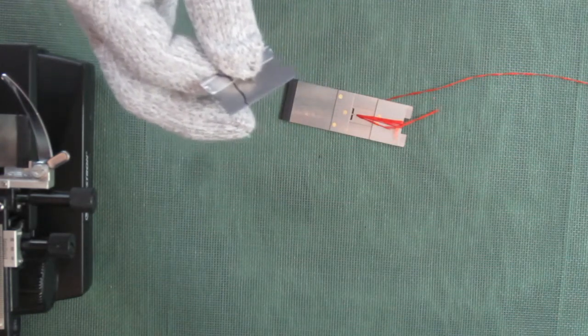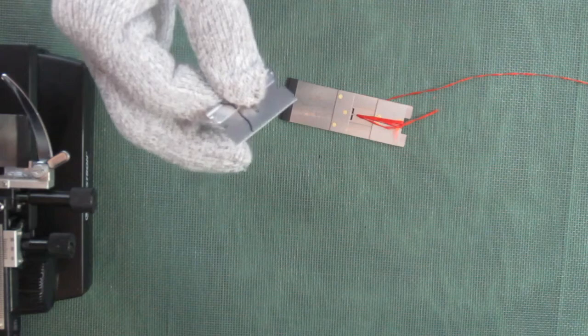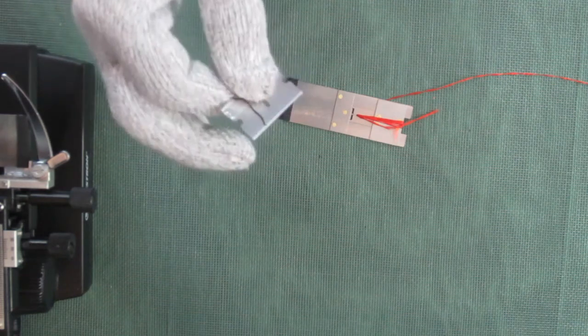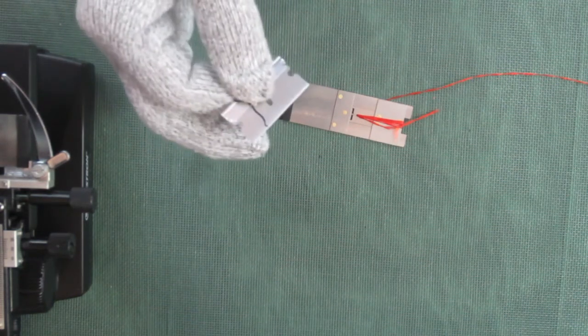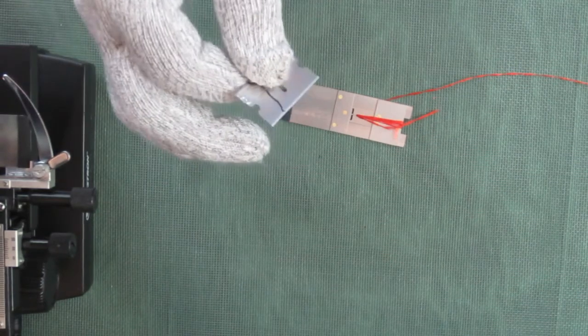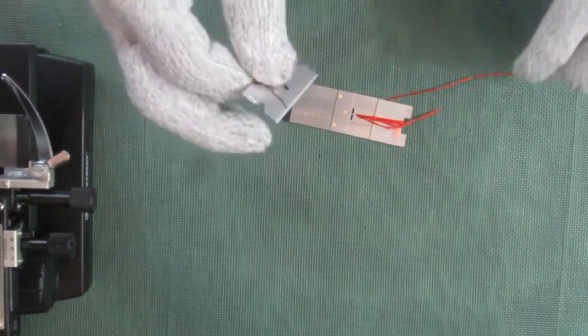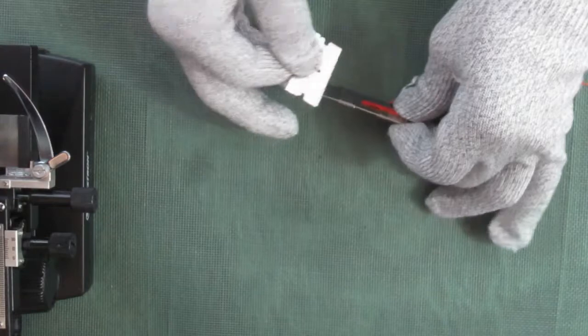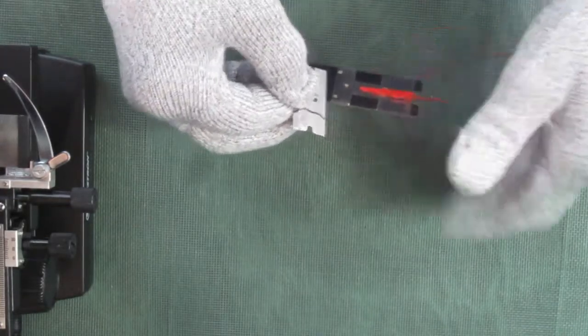Do not try to get more than one sample per razor blade. You're just going to get aggravated because your cuts are not going to come out right. You need a fresh razor blade each time.